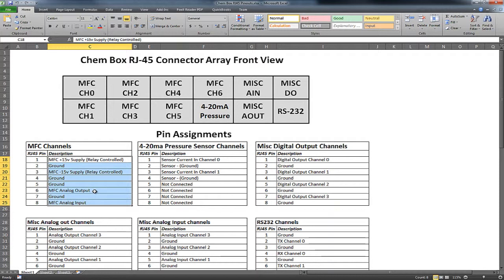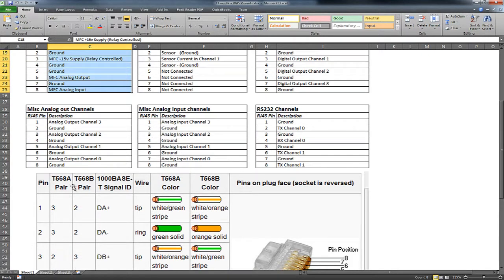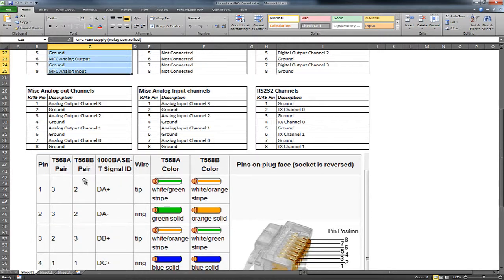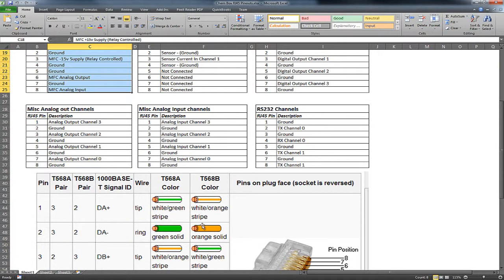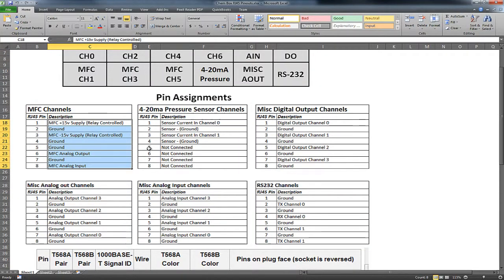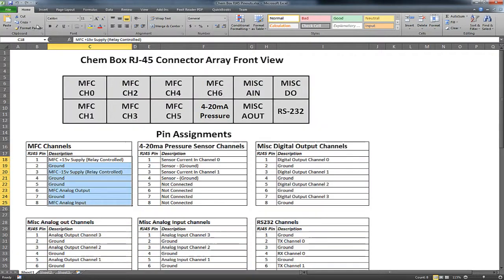Now the only thing you need to know, if you're making your own cable set, is whether that cable is wired for T568A, which is newer but more common in Europe. Most US cables are T568B. So it shows you the pin and then the color, all right? And then you can map that to the signals you need. So it's a quick cheat sheet, and you can use this directly.